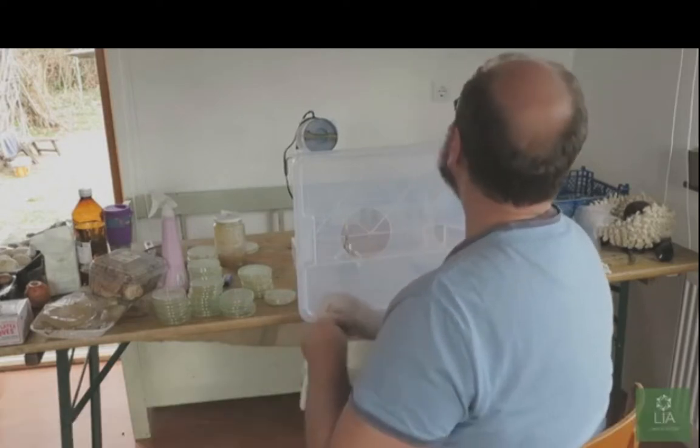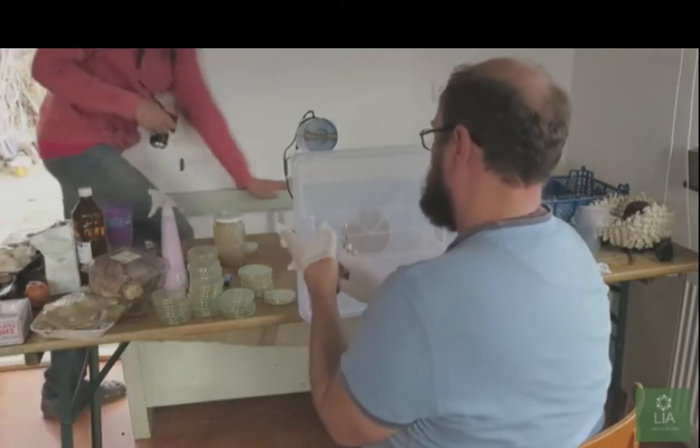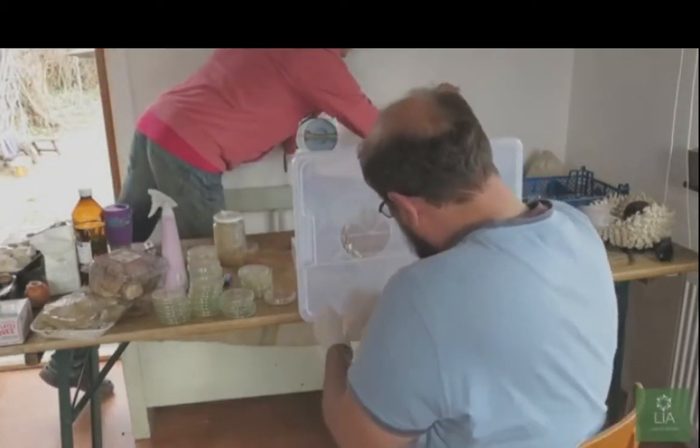Right, so Dave, do you want to switch that? I mean, he's obviously had success. He knows what he's doing. As always, sterilize everything. The flame burner is inside? Oh my god! Are you kidding me?